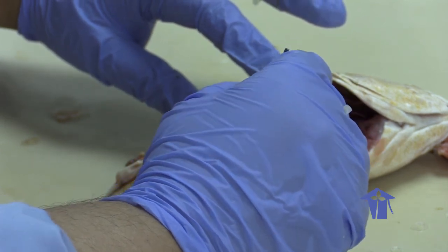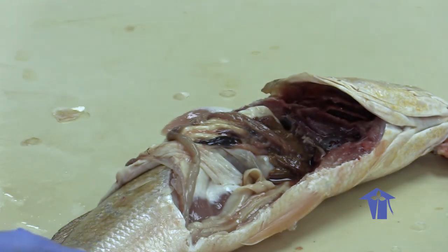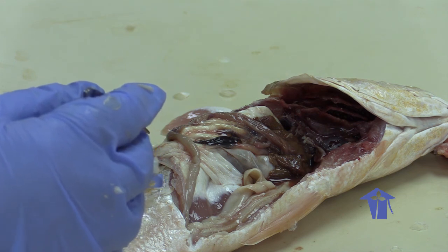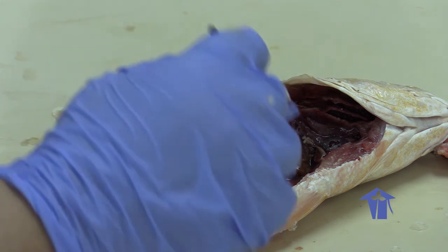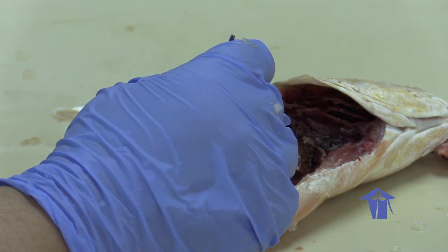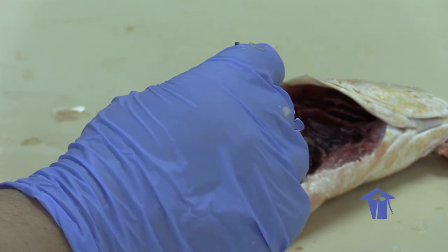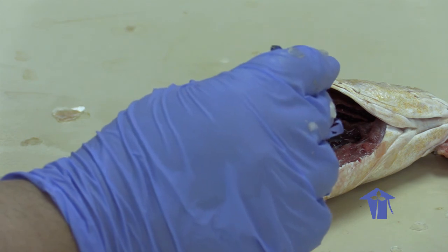Some fish actually do have crops as well. Some fish will actually have parts like catfish, the cascadoo, for example. Part of its intestine is going to be thin wall and vascularized, so it could work for acquiring air as well, right? Those are the air-breathing fish. But the gut of a fish is usually not as differentiated as you would see with a land mammal, right? So that is the digestive system of our fish.